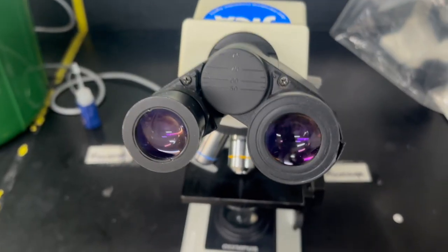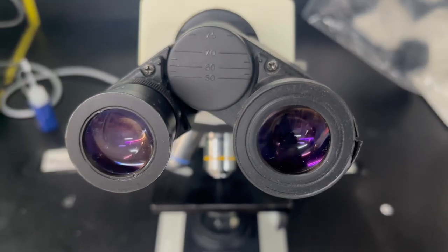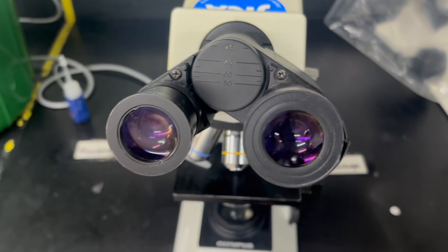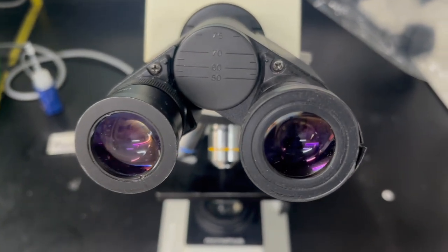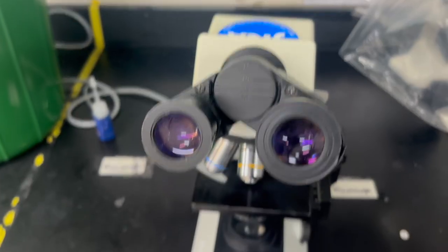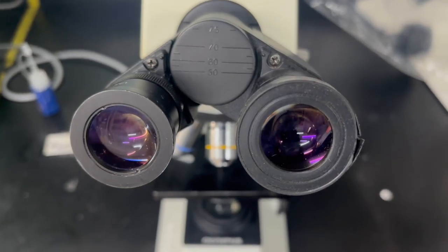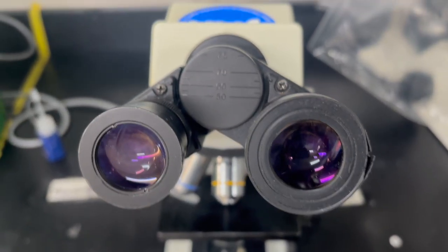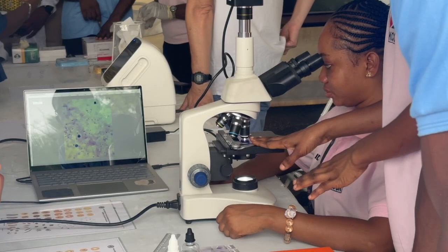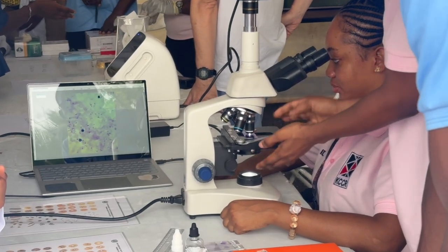If you notice, you will have the 2 eyepieces or oculars and you want your eyes to fit in there. Because everyone's got different widths apart that their eyes sit, you have to adjust the oculars for your eyes. The aim is to have the field of view for your left eye and the right to come together. So you may have to adjust the oculars as you would a binocular, if you've ever used a binocular at a sporting event.